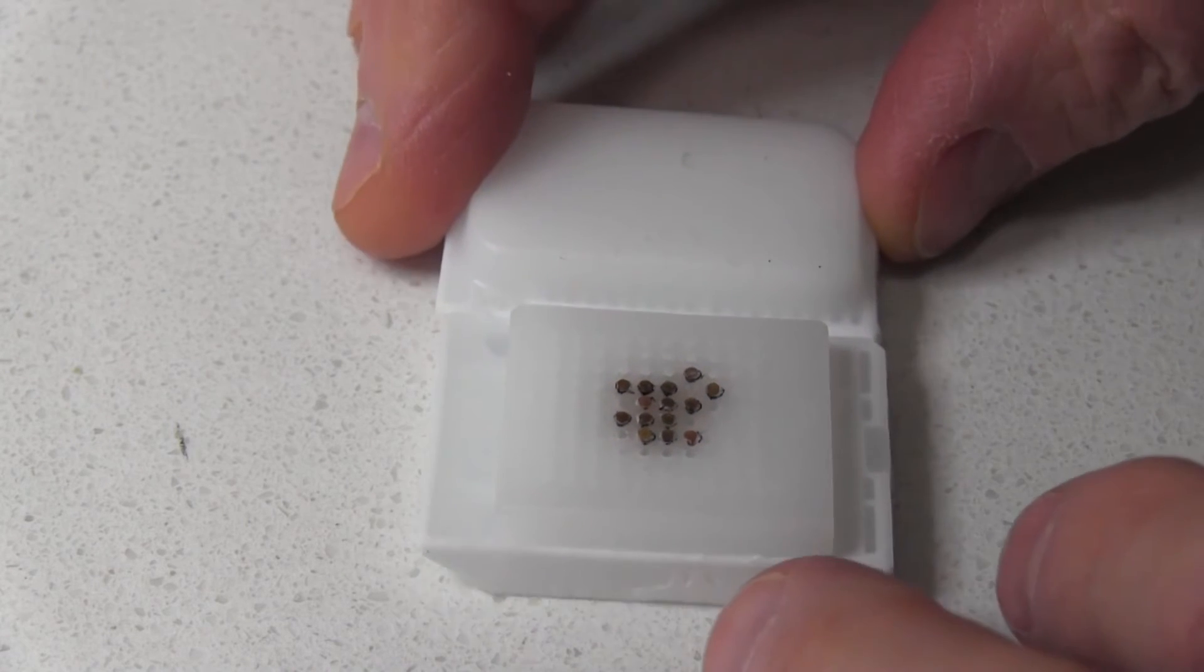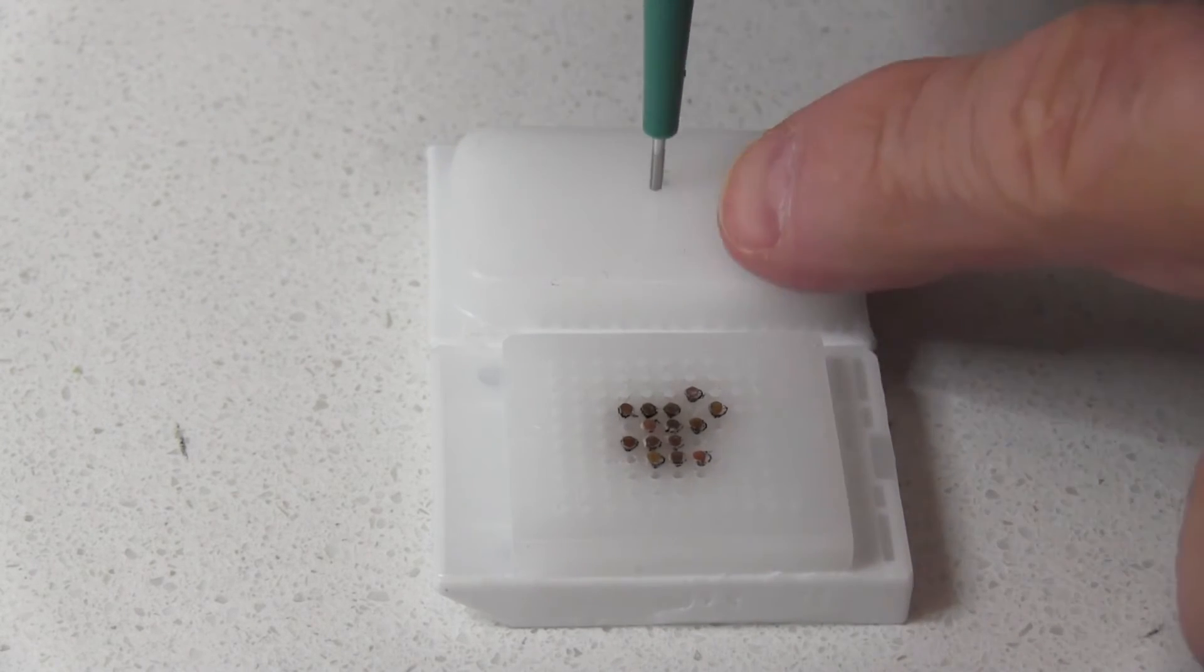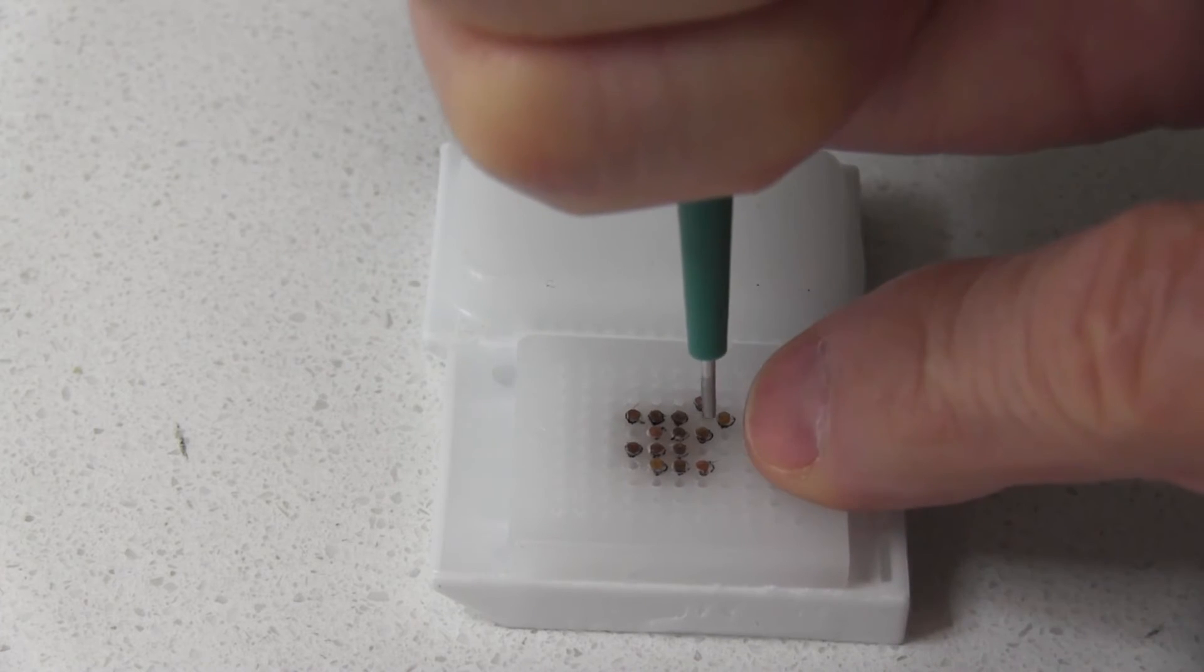There are a lot of empty holes and they will need to be filled. I have created a blank paraffin block with paraplast extra paraffin for this purpose.